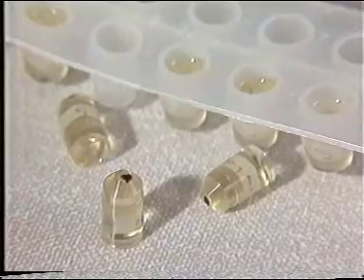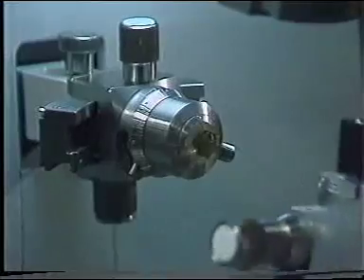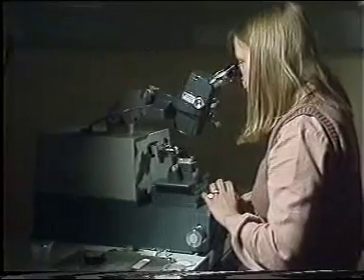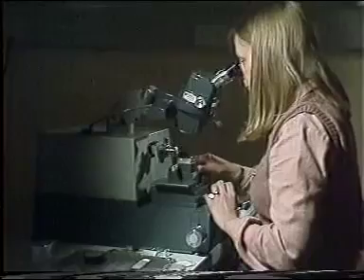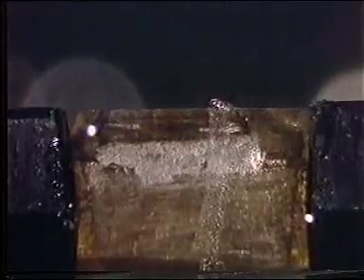Whereas in optical microscopy, sections about 10 microns thick are good enough, in electron microscopy, they need to be 200 times thinner, as electrons have such a low penetrating power, and these sections are cut on an ultramicrotome. By careful alignment of a sharp glass knife edge with the specimen, ultra-thin sections can be cut. The specimen holder moves down in the knife edge, producing a ribbon of sections some 50 nanometers in thickness.